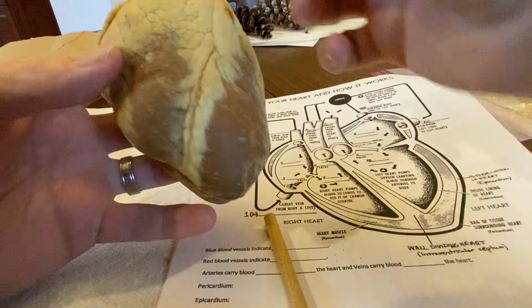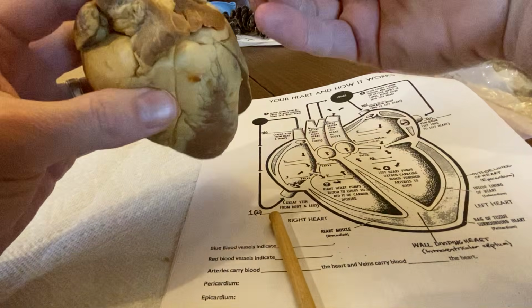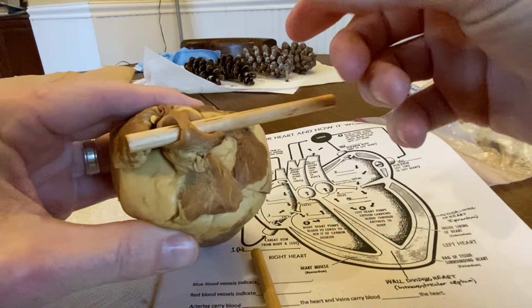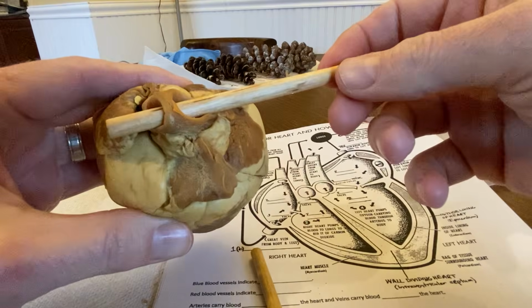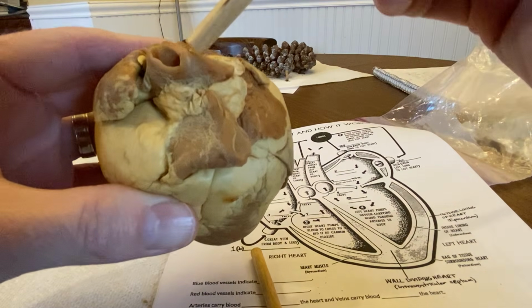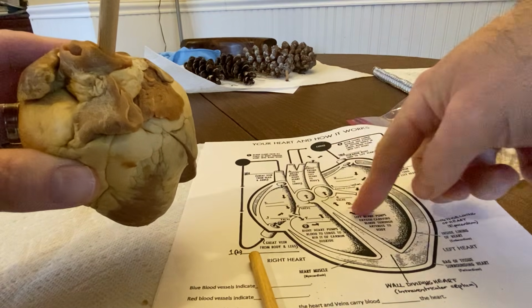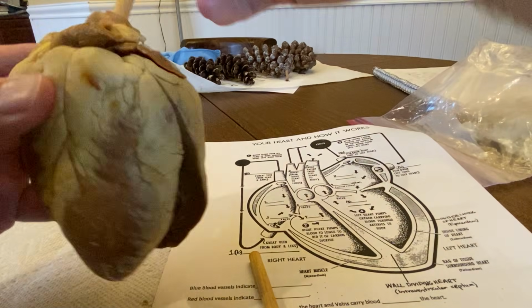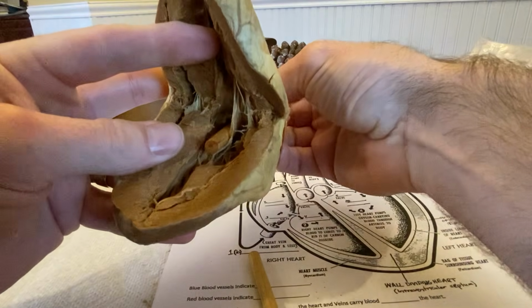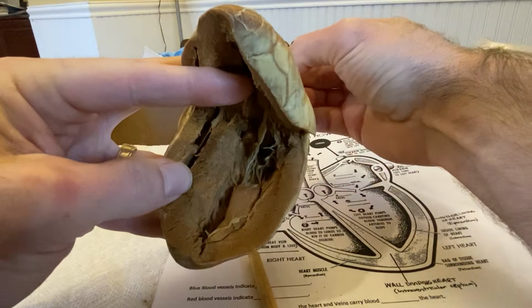The other main blood vessel that I usually do in our lab is the aorta, and there are actually multiple branches here. Sorry, the angle's off a little bit. This is all going to be aorta here. We know that because if I push this down through, based on our big diagram, aorta down and through, it should take me into the left ventricle. So let's find out. A little bit of wiggling. Push this down in here. And there is the rod coming out right into that left ventricle. So the blood would go right up there.